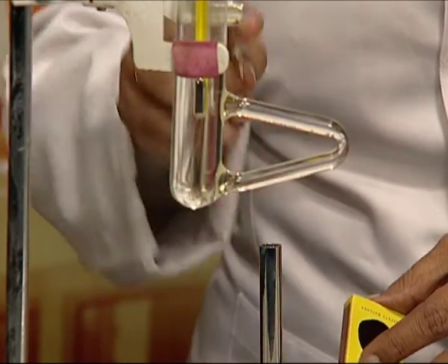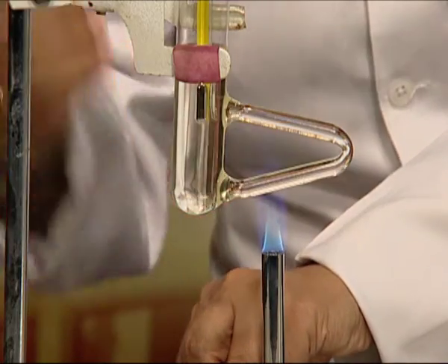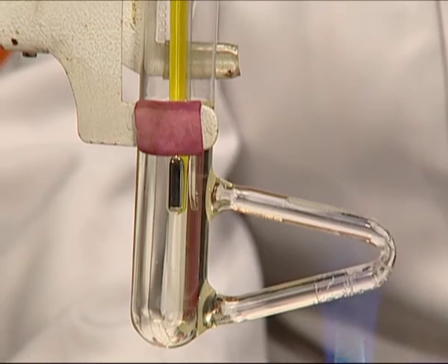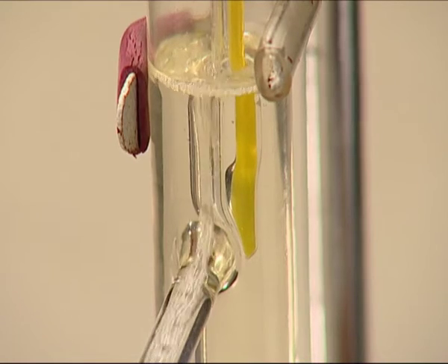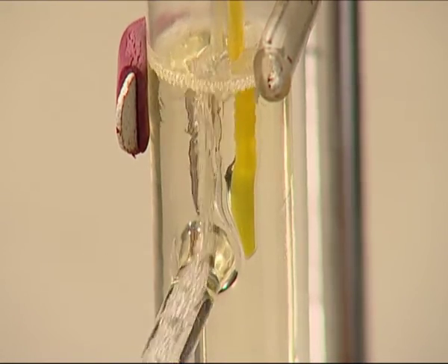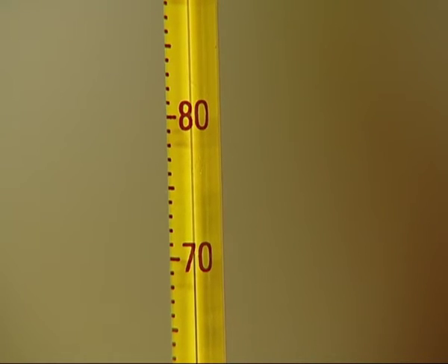Now we will start heating the bend of the Thiel's tube gently. Slowly and gently move the burner only on the side of the bend of the Thiel's tube to ensure uniform heating of the substance. We will note the temperature when the solid starts melting. At this stage, the temperature becomes constant for some time, and this will be the melting point of the organic compound.